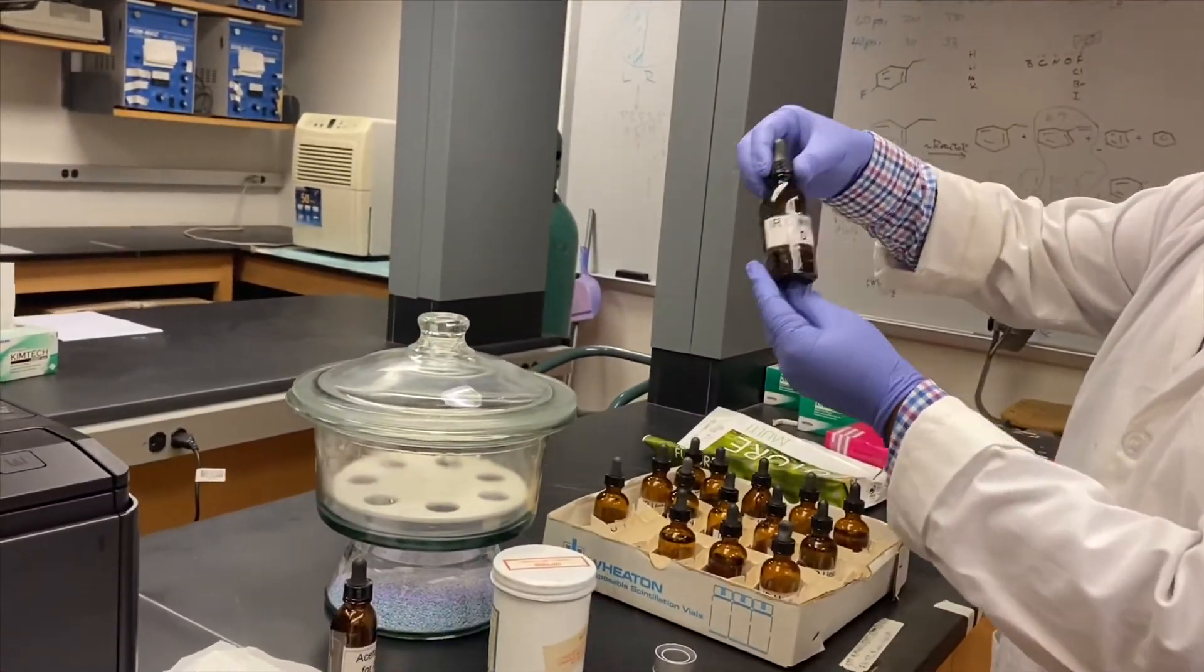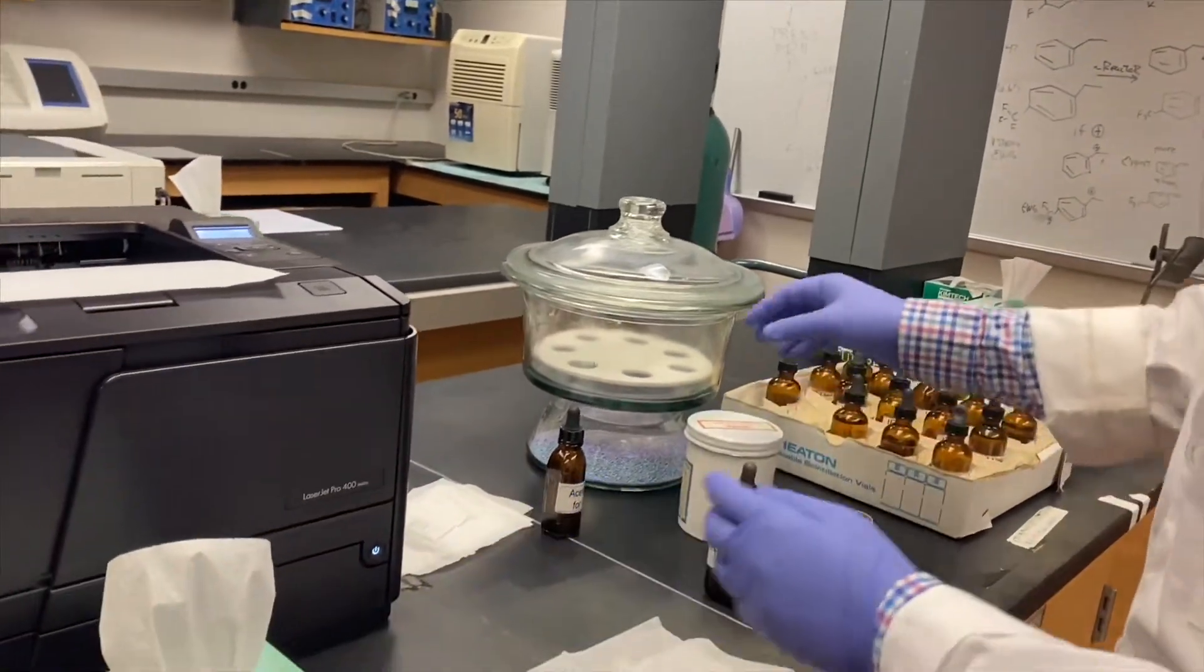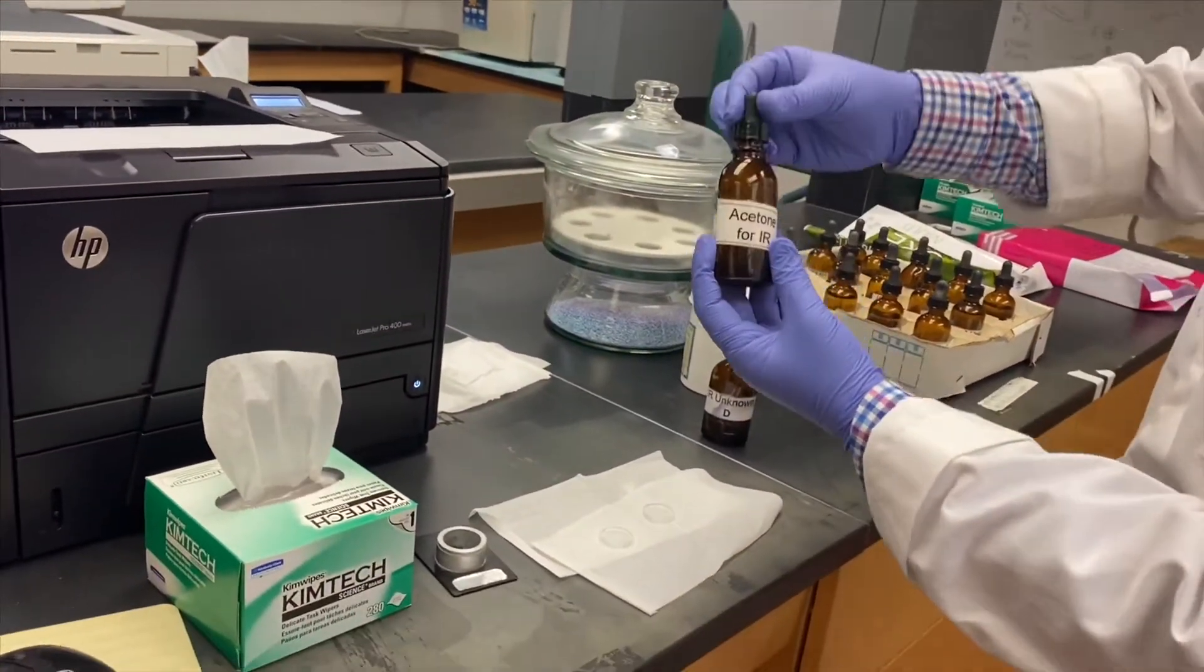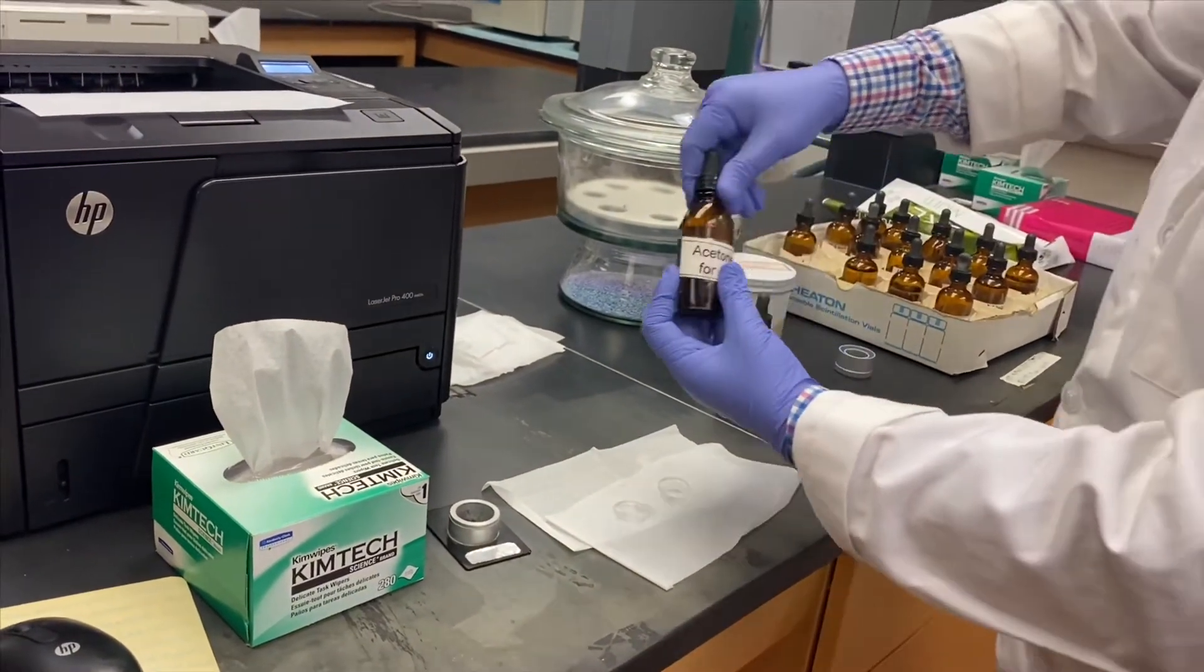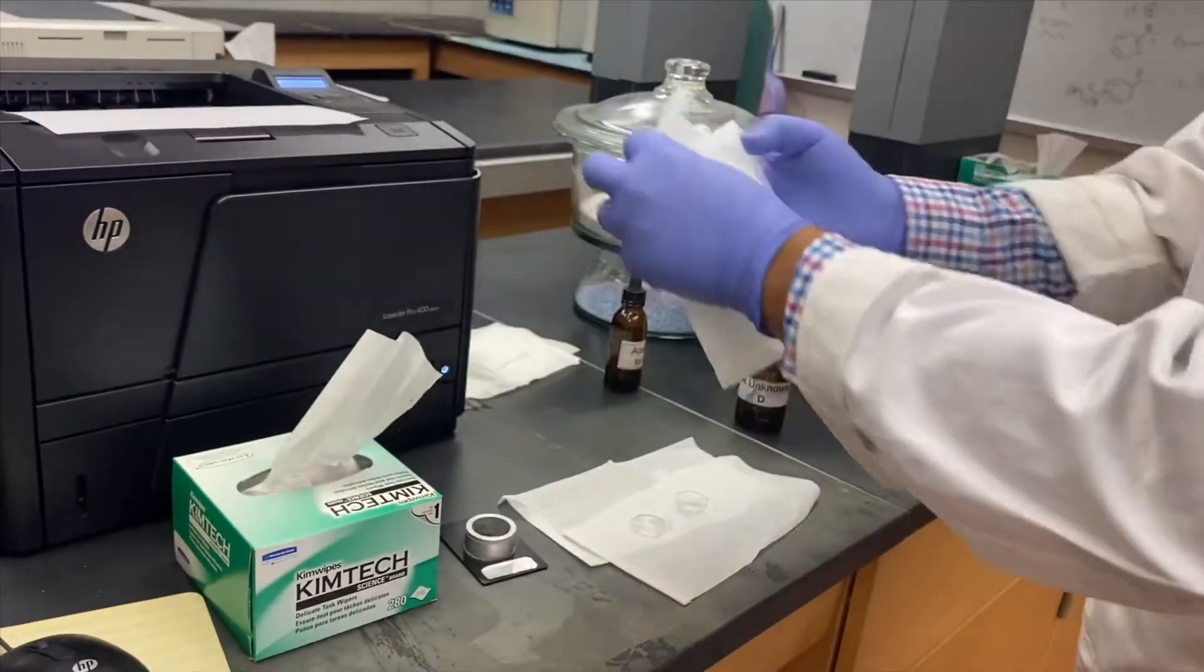Once done with your sample, you will clean it with acetone used for IR, either before storing them back in the IR box or before doing any new sample.